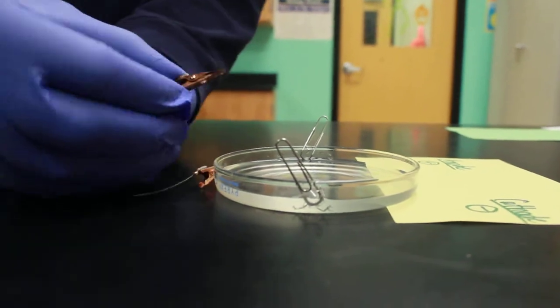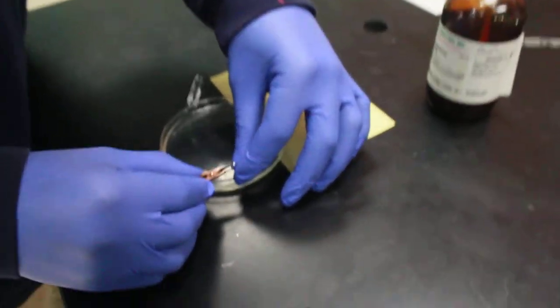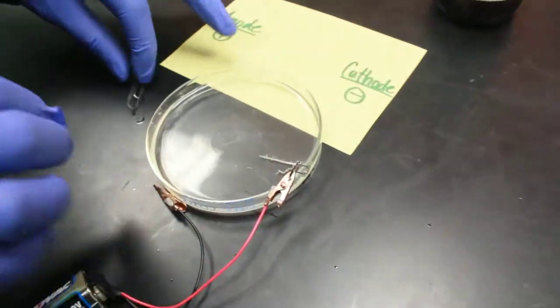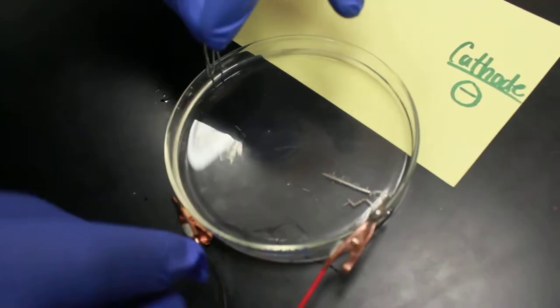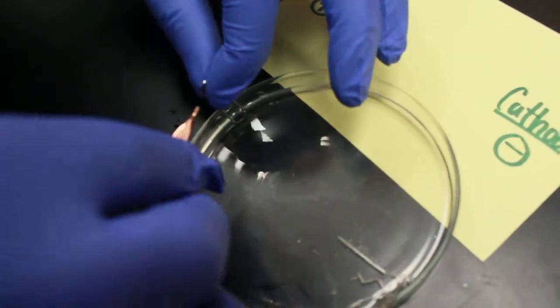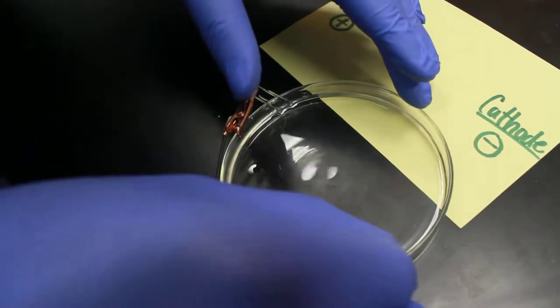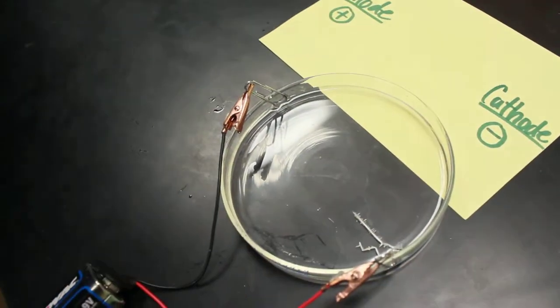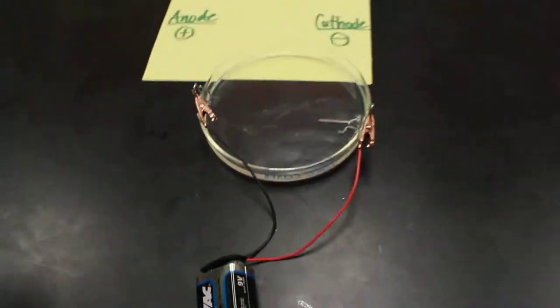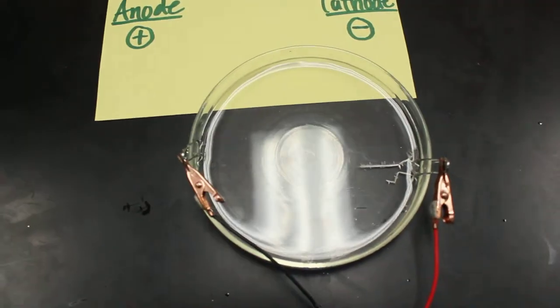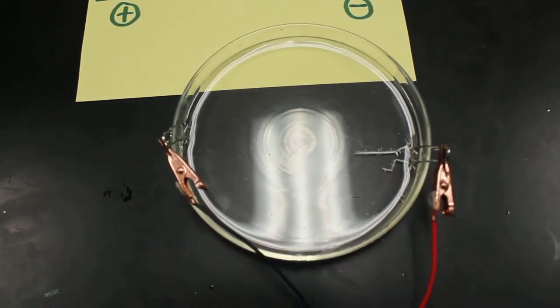Now this will cause the opposite reaction, which you will see. Now if you can witness this, the cathode is starting to dissolve, or it should be dissolving now.